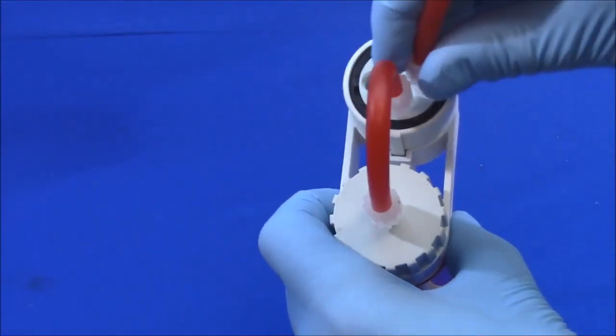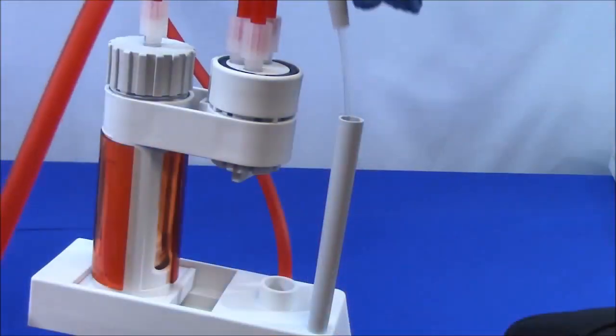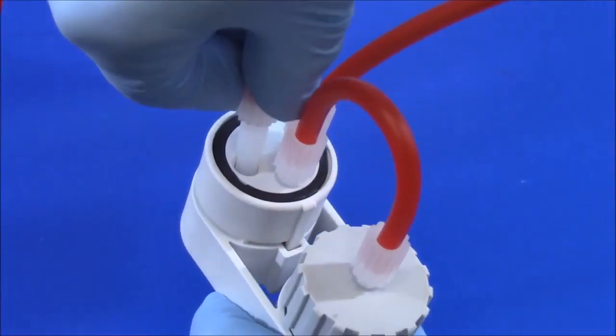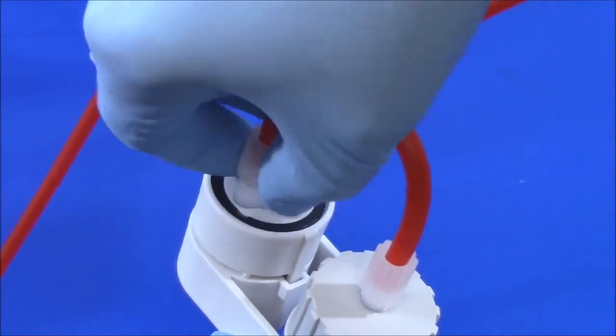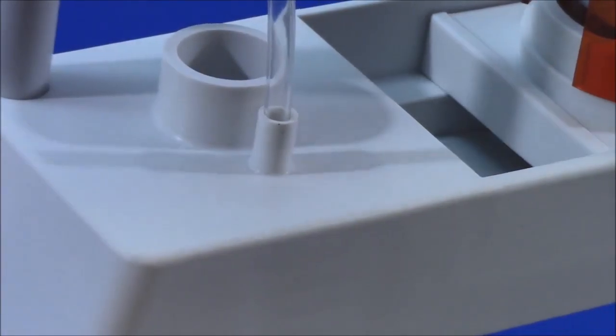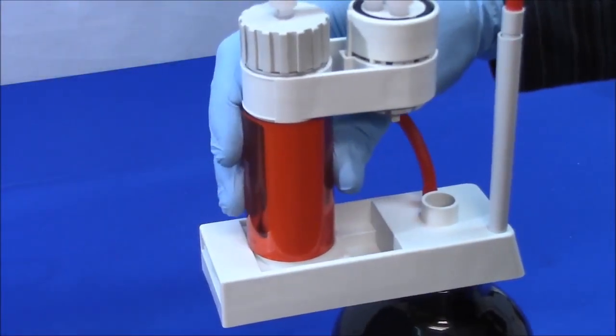To assemble the burette, the dispensing tube is attached to the right side of the stopcock valve, and the burette tip is placed in the burette holder. The suction tube is fastened to the left connection on the burette head. The other end is pushed into the titrant bottle, the red tubing pushed onto the fitting. The burette can be stored on the burette stand.